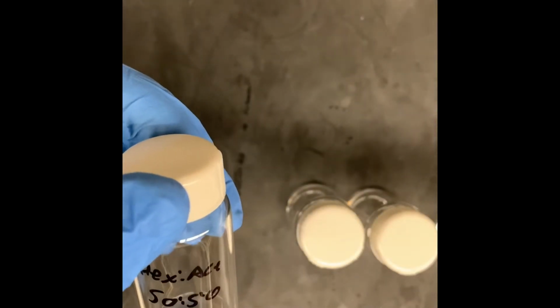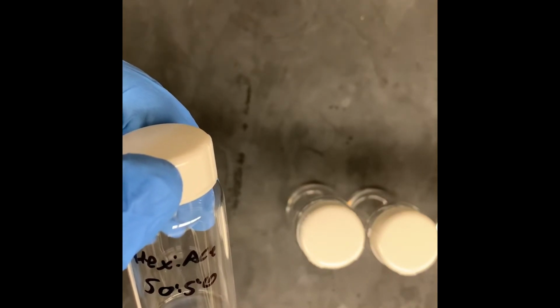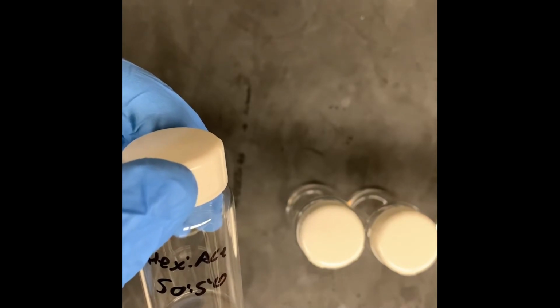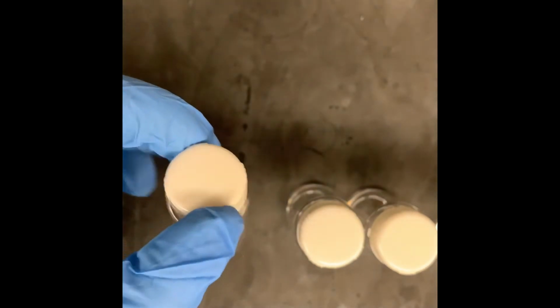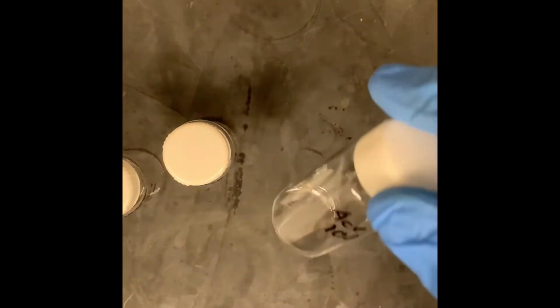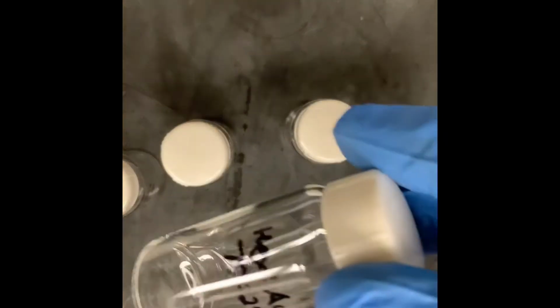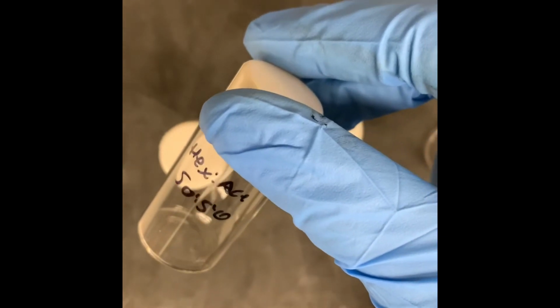All right, so following along with your pre-lab assignment, now what we would do is prepare the solvent chamber solutions that have a total of 0.5 mL, and we would use a micropipetter to do that. We would prepare one solvent chamber that had 50% hexanes, 50% acetone, one that had 25% hexanes, 75% acetone, one that had 100% acetone, one that had 100% hexanes, and one that had 75% hexanes, 25% acetone. And these vials, these solvent chambers, are where you actually deposit the TLC plates that we just spotted.